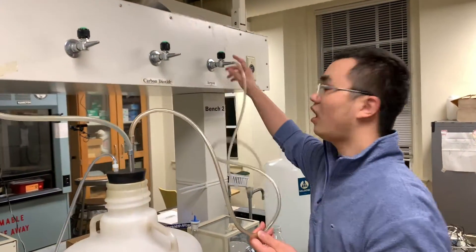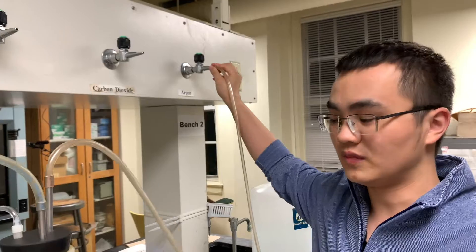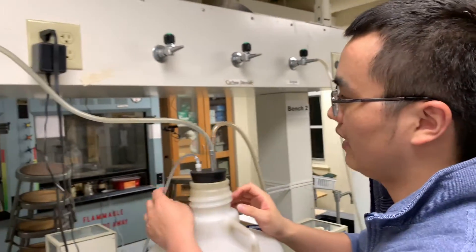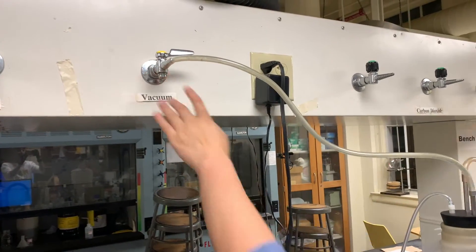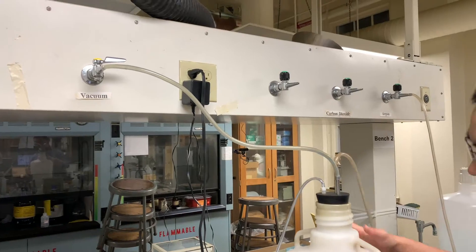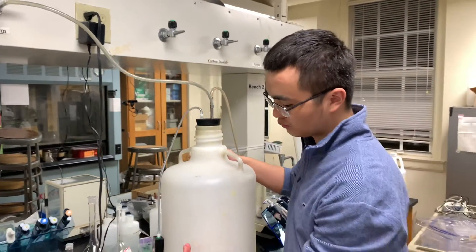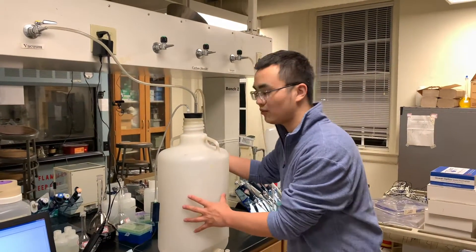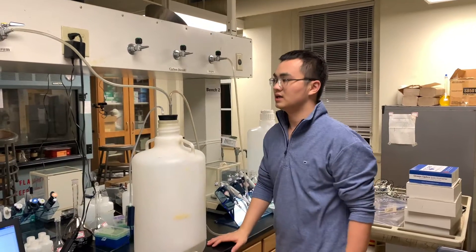The second tubing is connected to our desired gas — in the first case of our experiment, it's going to be argon gas. The third gas tubing is connected to a vacuum. Before the experiment, the carboy is filled with air and other gas impurities. By pulling vacuum on the carboy, we can remove these gas impurities, and later we can refill the carboy with our desired gas such as argon.